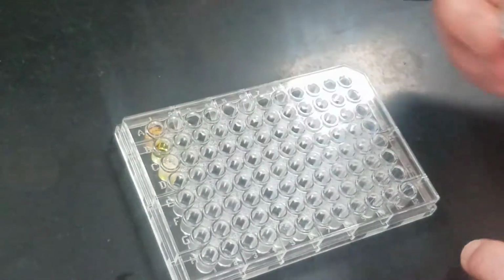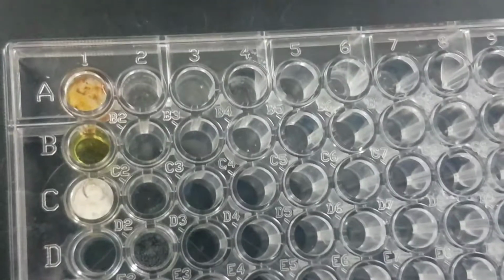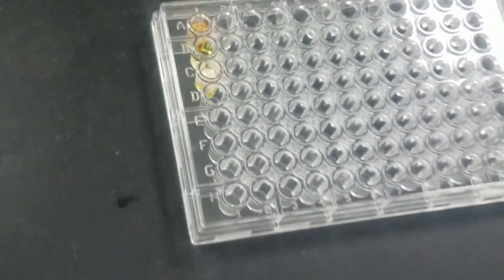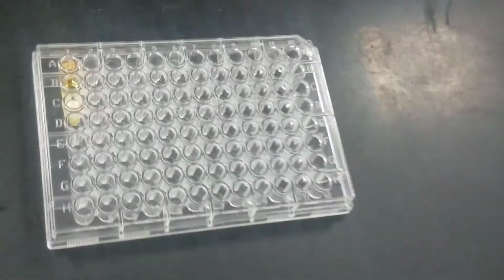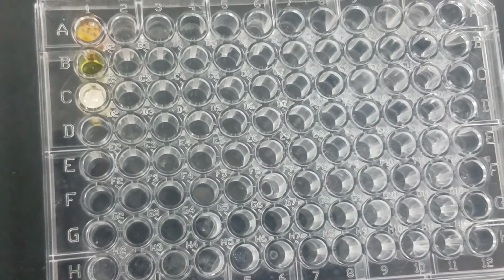Now if you look at that, you can see that there's definitely a precipitate. It's cloudy, you see it's like white. So write that down in your report that there is evidence of reaction and you got a white precipitate. That's iron chloride and silver nitrate.